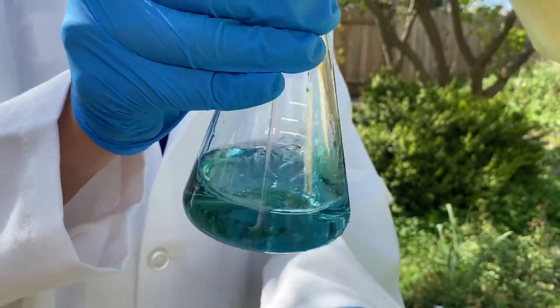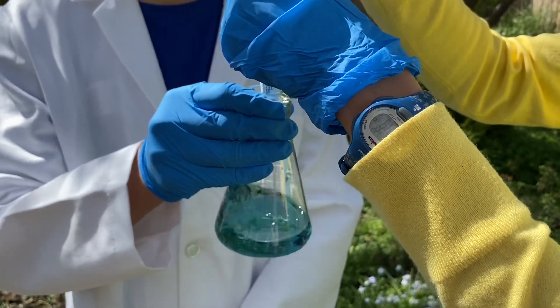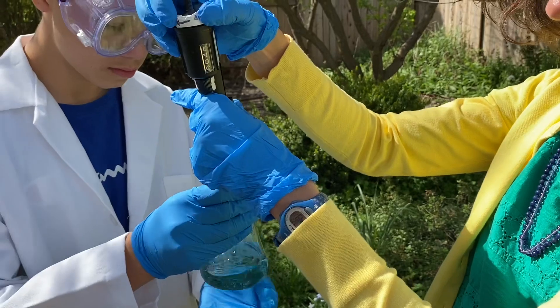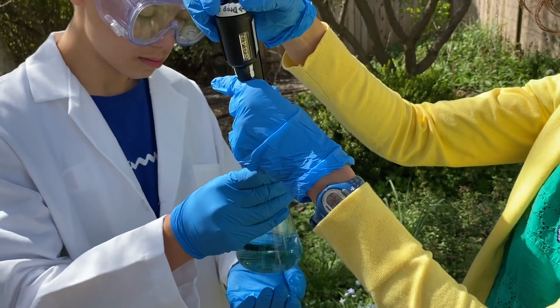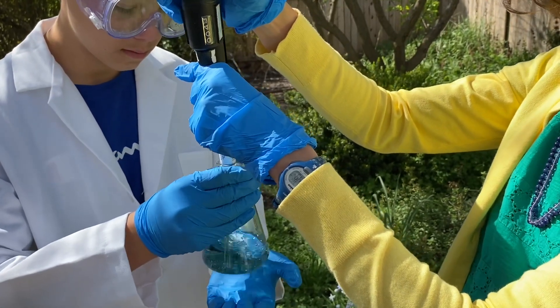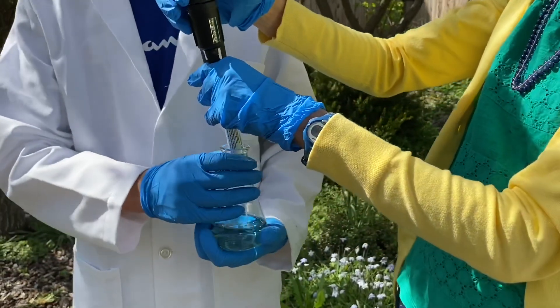It's starting to look purple, but I'll slow it down a little bit. We're at 40, 41. I probably should have calculated in my head how many drops I would have to do. Does that look like a different color, Eli? It's starting to look a little grayish to me. Show it on your coat — yeah, it's starting to look a little grayish, colorless.